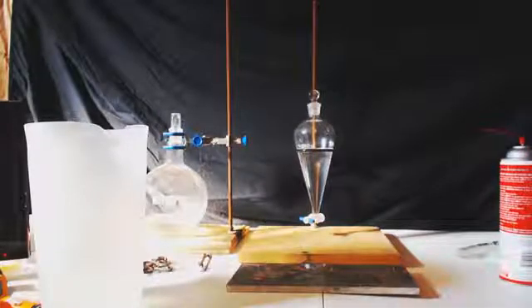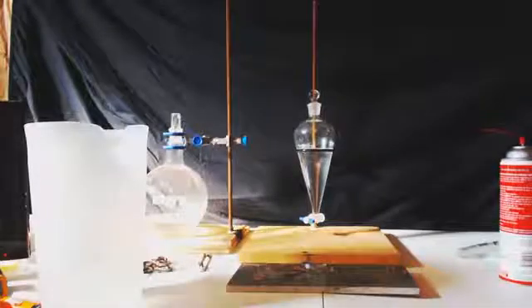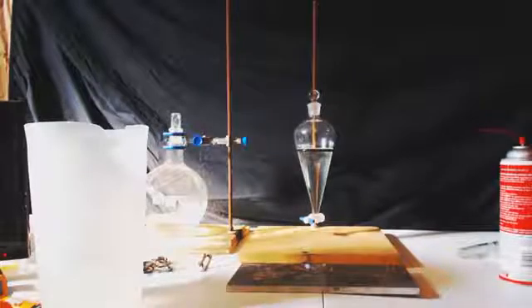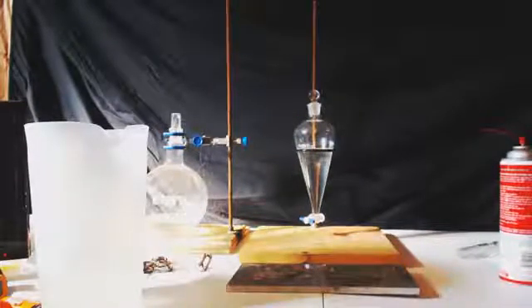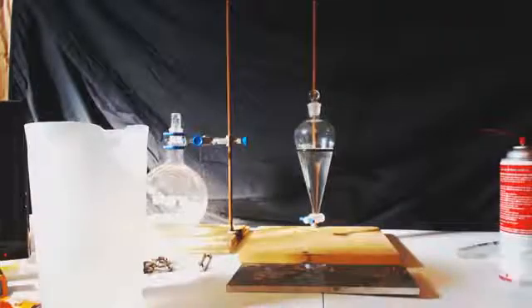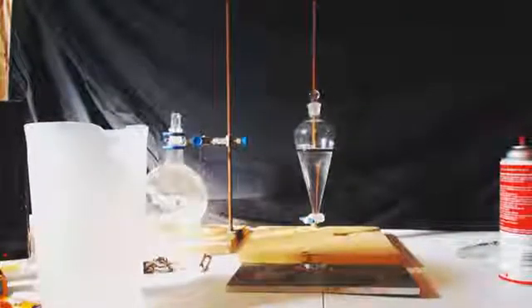Well this is John Black, super chemist. While I'm waiting for some other thing to happen might as well do this short little simple video. It's about boiling stones. You know I never actually seen boiling stones until recently and they just look like little sand granules. I always use these.